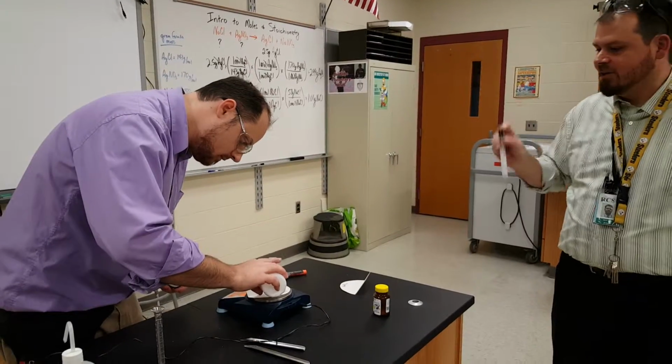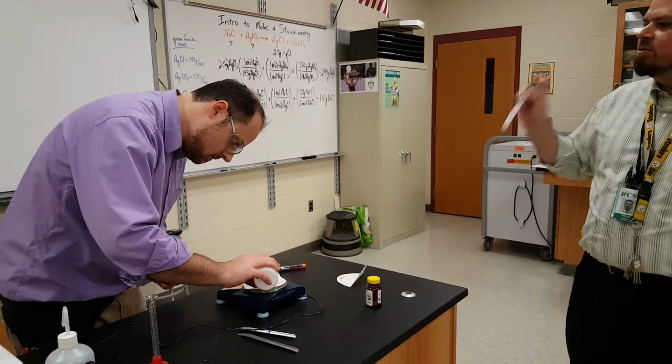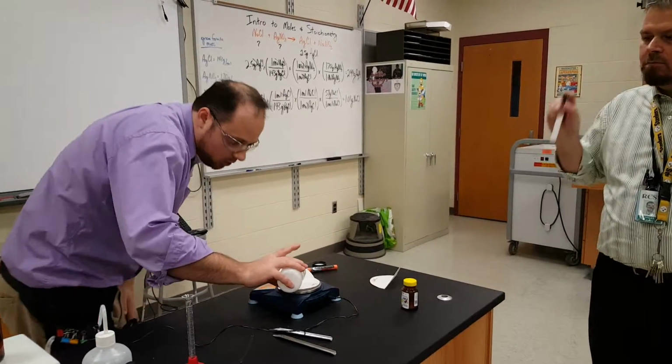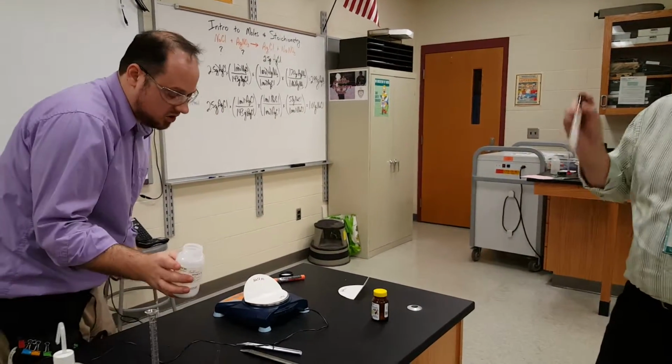While you're doing this, I have a great question for you. Why would you not use more silver chloride? Because the silver chloride's expensive. There you go. It's got silver in it.